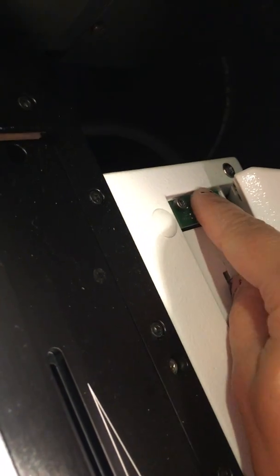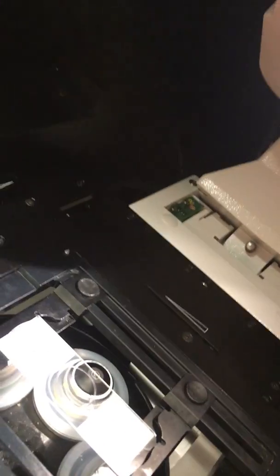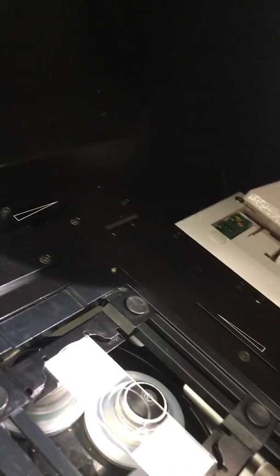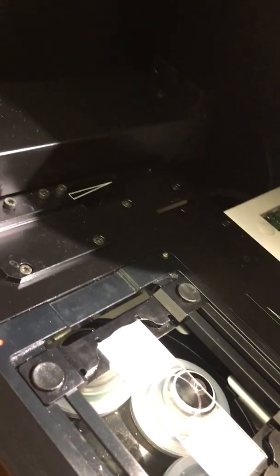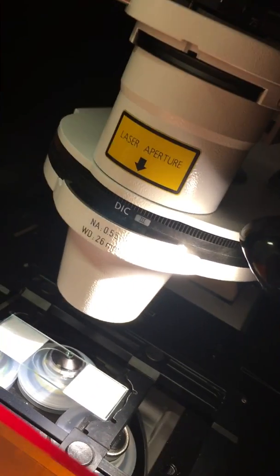Here on our 780 there are two contacts which need to make contact with these two things here. This is a safety measure preventing the laser coming from the lens while the head of the microscope is tilted backwards. On our 800 we have a different type of safety measure, but please put back the head of the microscope very gently in order not to crush these contacts.